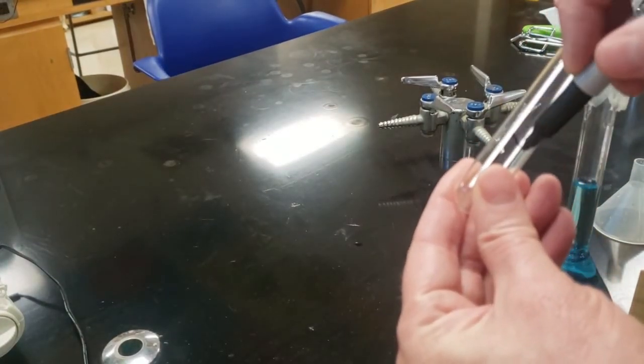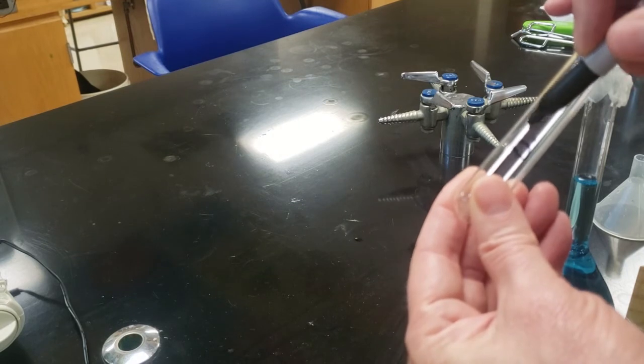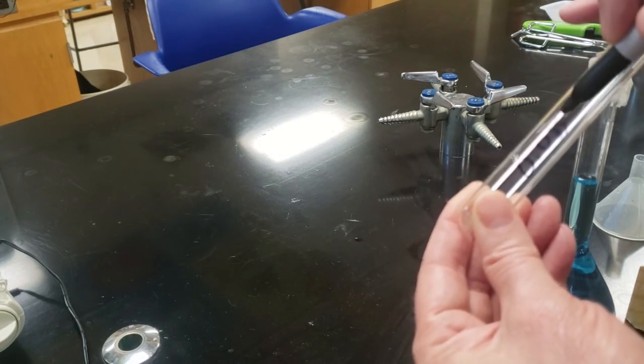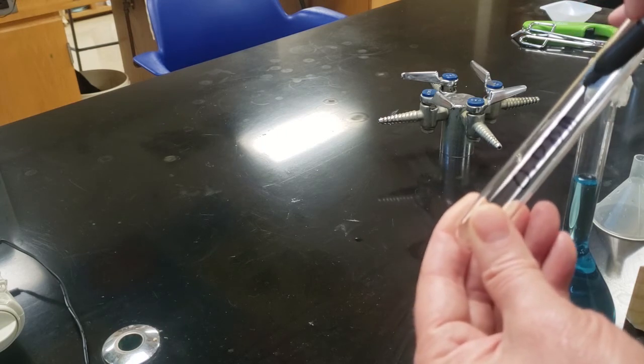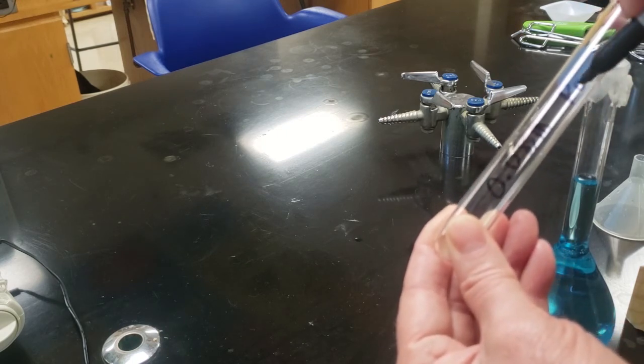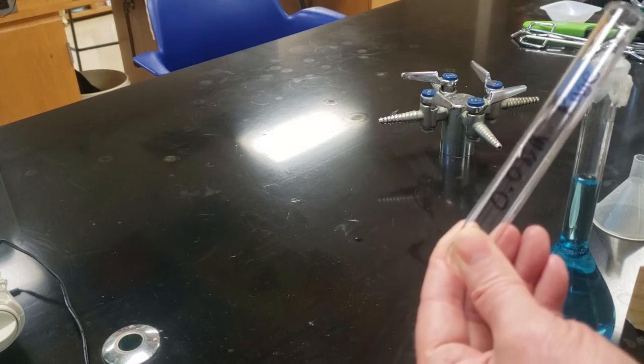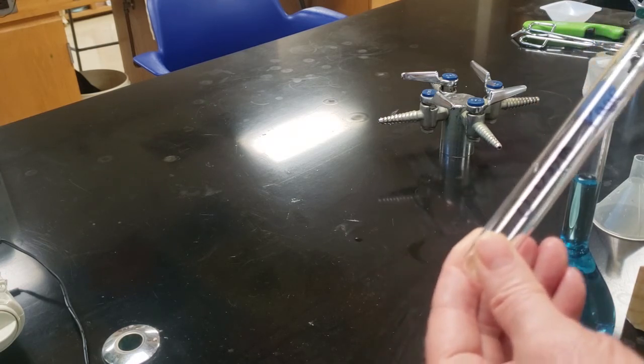Now we're going to put our name, either our initial or something on there so I know whose it is, and then the actual molarity that you made. Everybody will be making something different. And we're going to test these afterwards. This video is only showing you how to make the solution, and any solution will be made the same way.